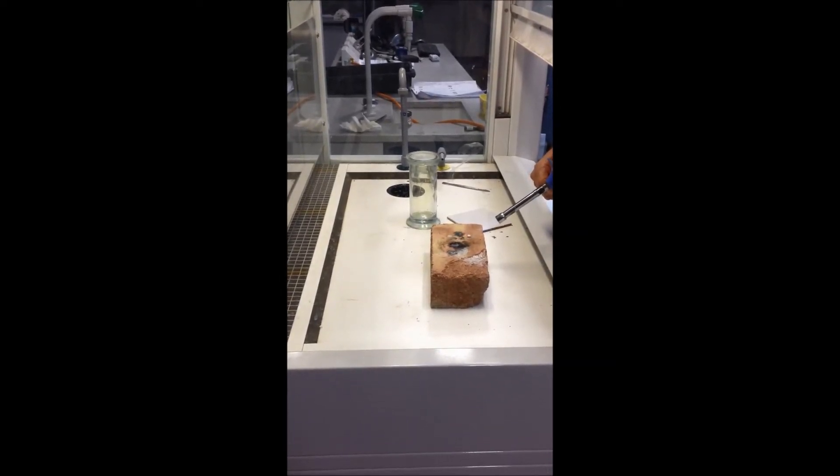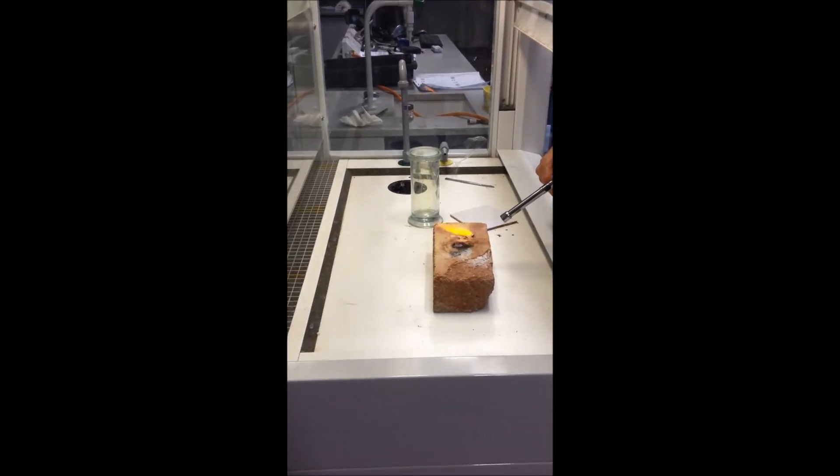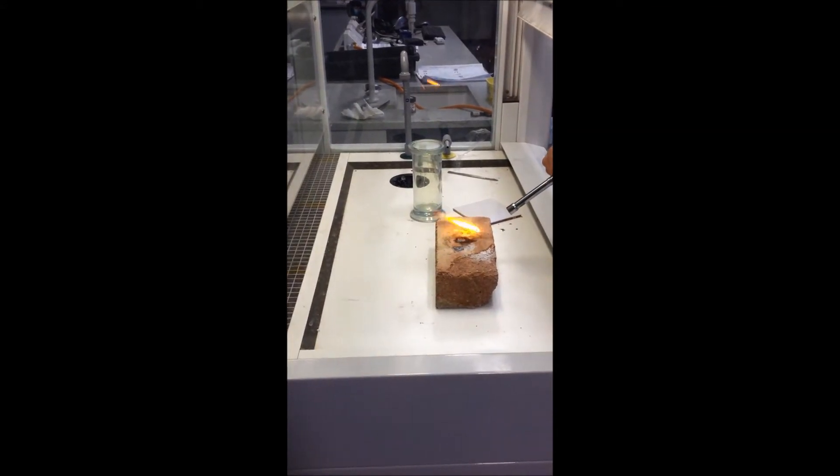All we're doing is heating it up and melting it. You see it turns into a ball, just like it did when it was on top of our water when we did our metals reaction.